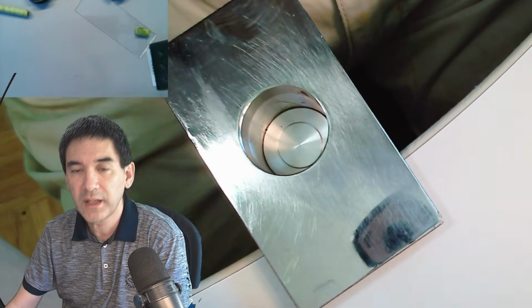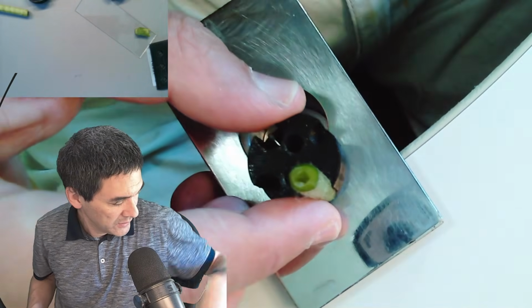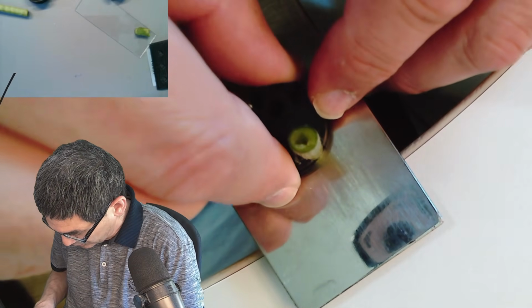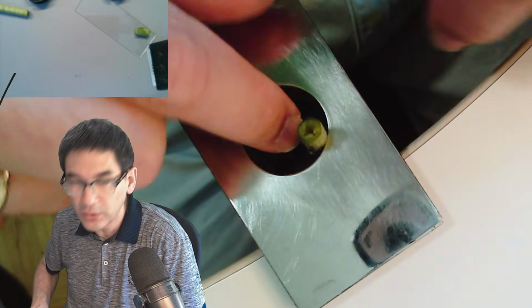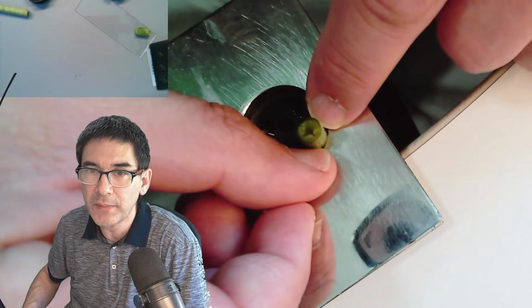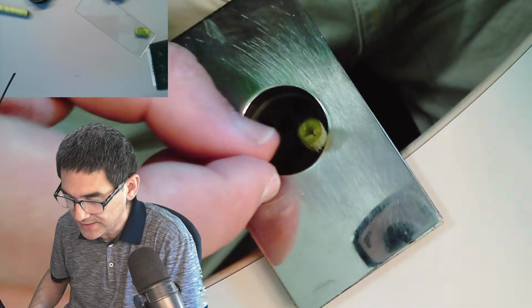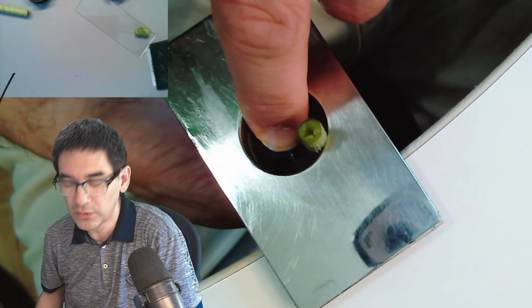This is it, and I'm going to now put this in here. I have to look down right now, and of course I'm also going to put on my glasses, and let's see how this works. To insert this, and here we go. It goes all the way in. Notice that I put the specimen right here at the edge, because the edge of the microtome actually acts as a support as I cut it. It pushes against it. So it's pretty far all the way in. I can turn it down even further, so it's all the way in now.